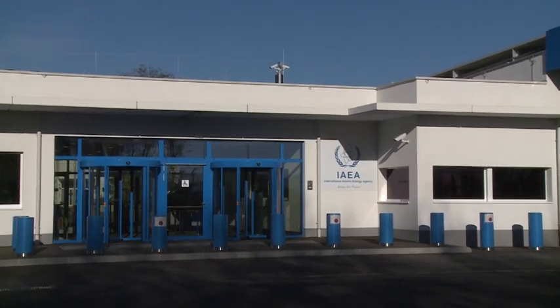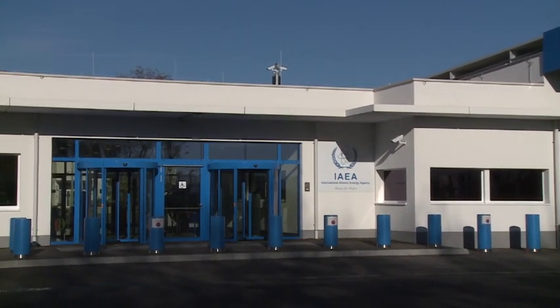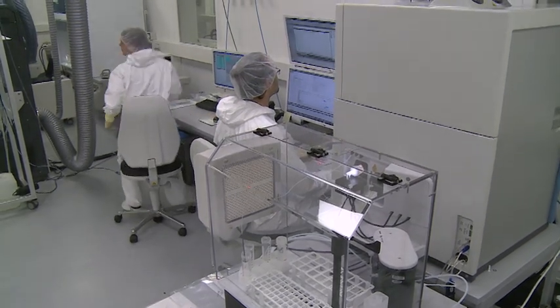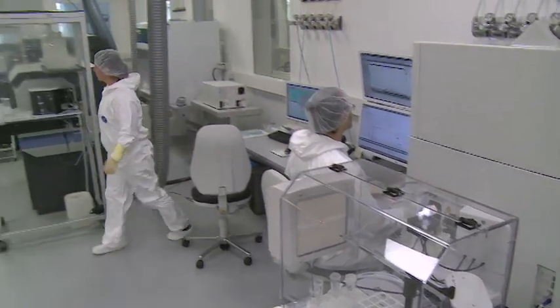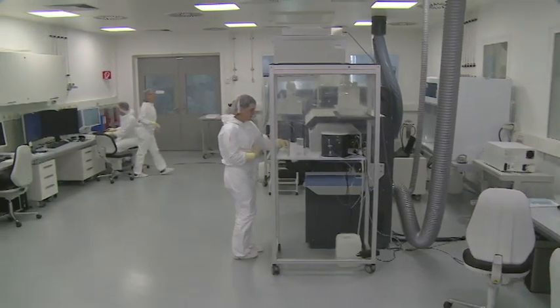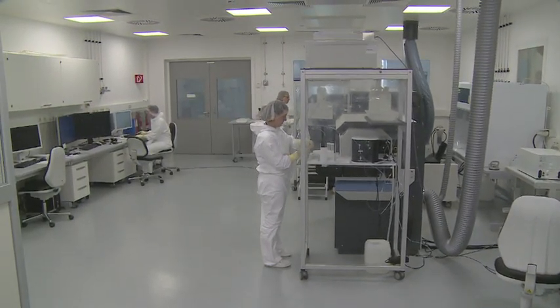The main role of the environmental sample laboratory is twofold. The first one is that we support the safeguards verification activities by providing the entire sample logistics for environmental sampling, and we also transfer samples from the environmental sample laboratory to the so-called network of laboratories.